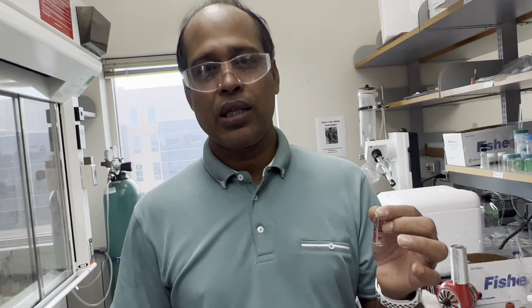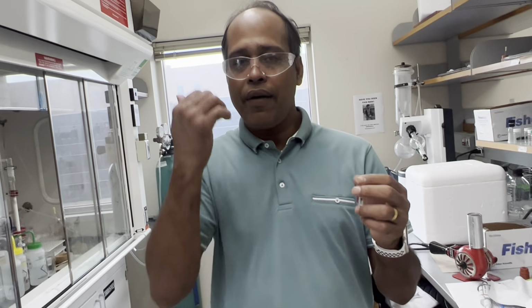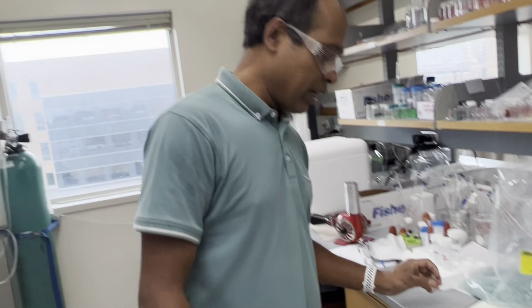So we will actually be adding 490 microliters of DMSO. A little less than that. Maybe we can use 400 microliters. And the rest would be because of the HCl, maybe like 350 microliters, and then adjust the acidity with a 1 molar aqueous HCl solution.